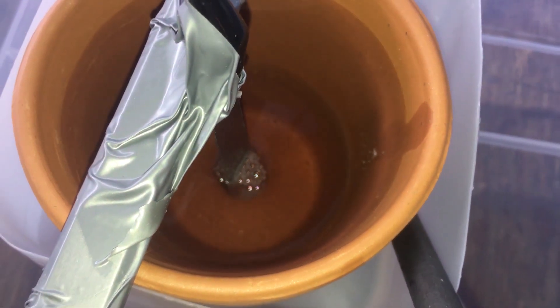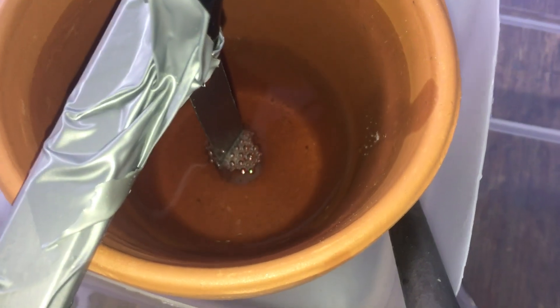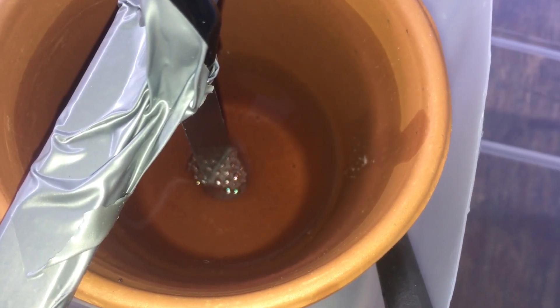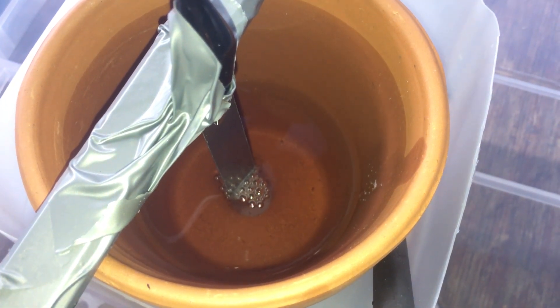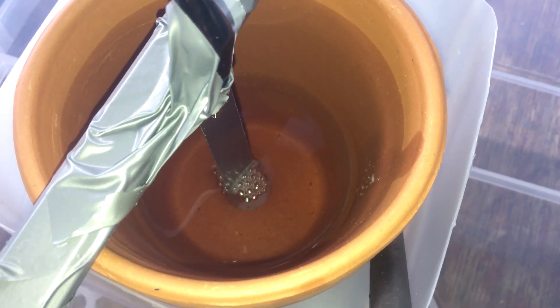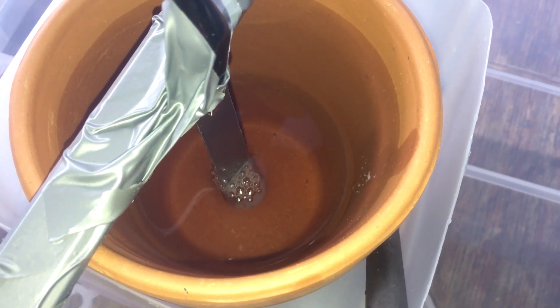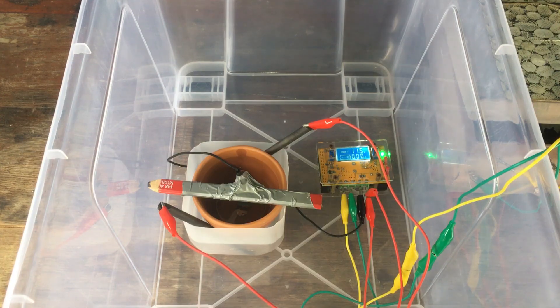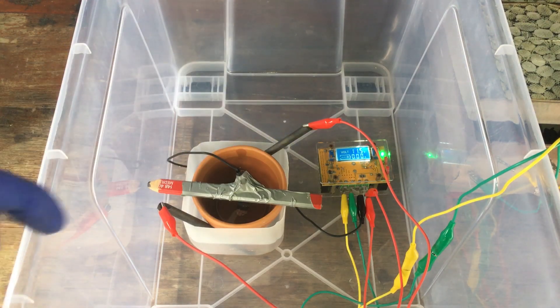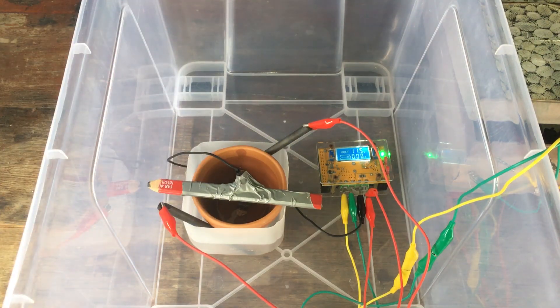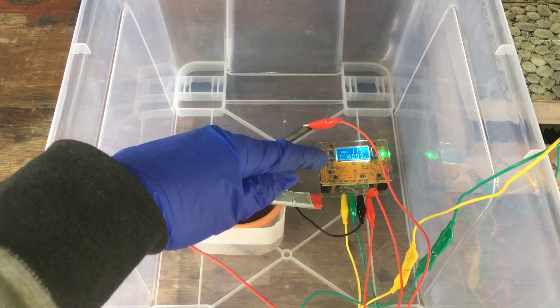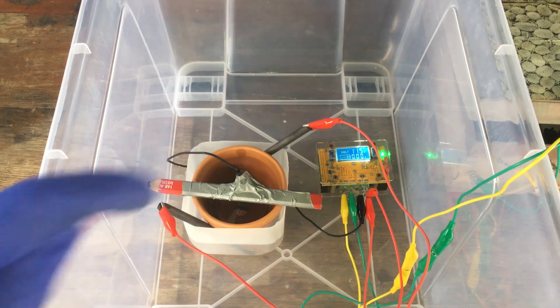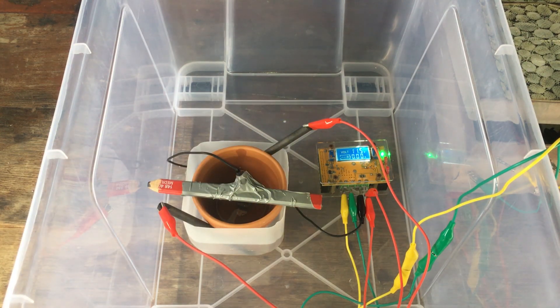And that is going to be the major product throughout the rest of the process. The formation of manganese metal on the electrode is a relatively minor process, because hydrogen is just so easy to form on the cathode that forming manganese only happens at a very slow rate. Anyway, the current will rise over time as the electrolyte soaks into the clay pot diaphragm. So that's nothing to worry about. I will probably set the current to a maximum of a quarter of an amp. I think is a good amount of current for the electrodes we have and the size of our cell.